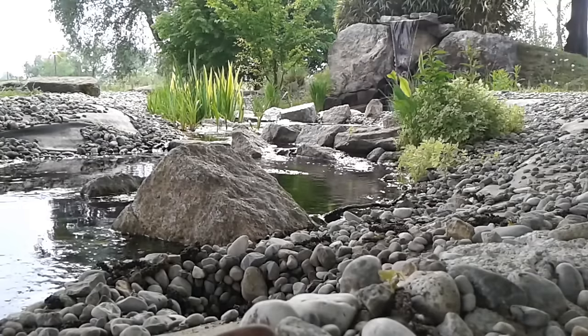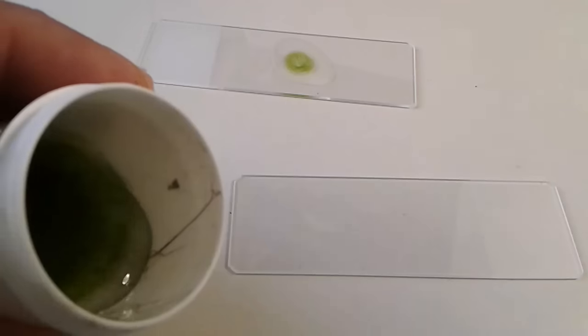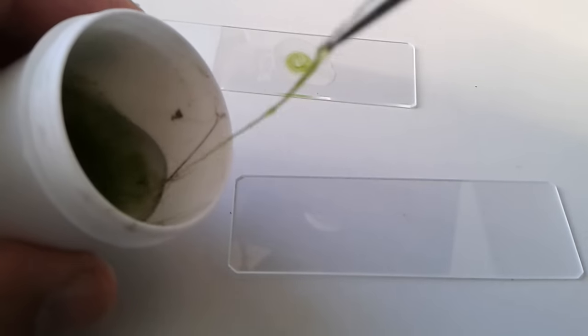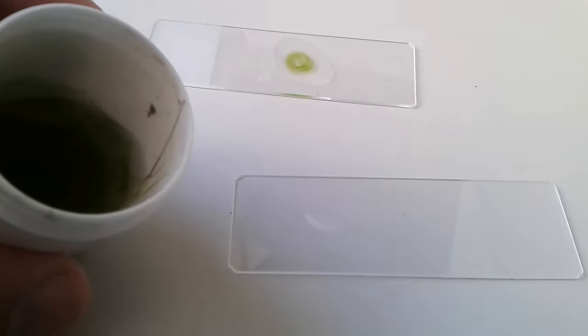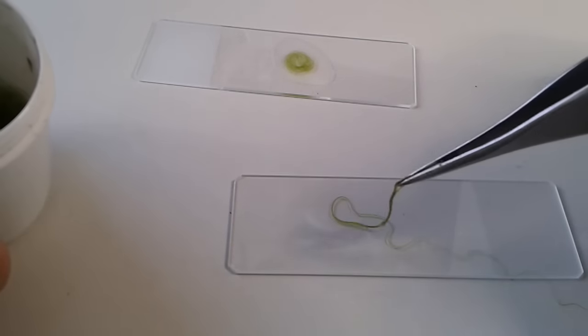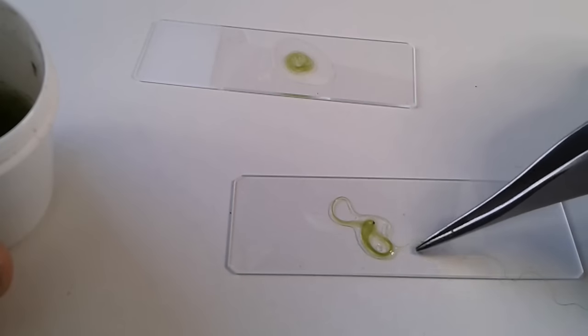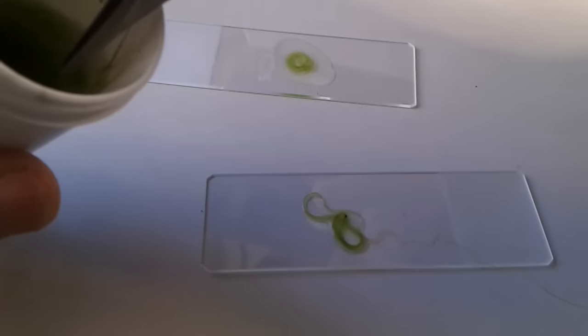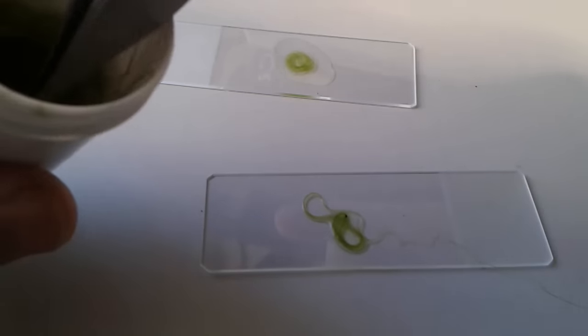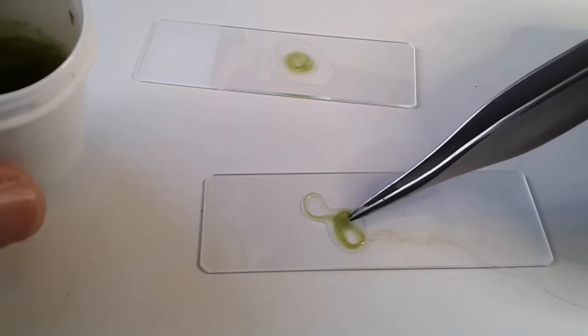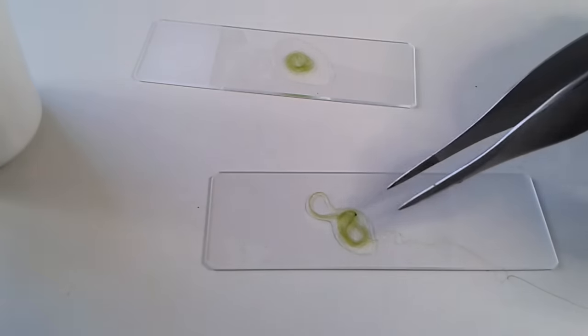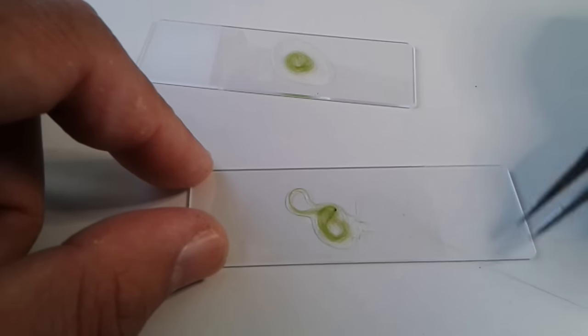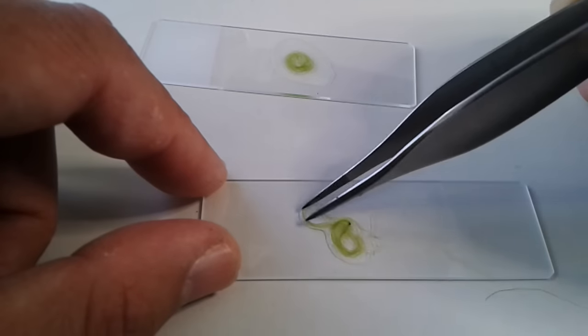Now I'm back in the lab. That is me working on my desk. It's not so easy to get the filamentous algae out of the plastic container. They're quite long. I'm preparing a drop of water and then a small cover glass on top. I think not only the algae themselves will be interesting to look at, but maybe there are also some ciliates swimming around. As you can see, quite long, those algae.